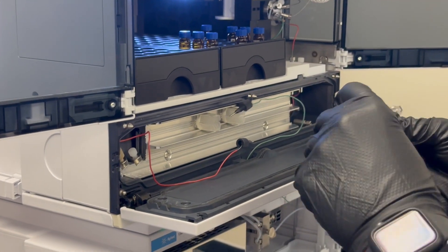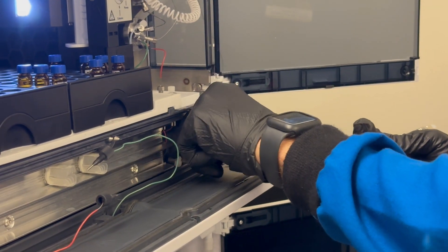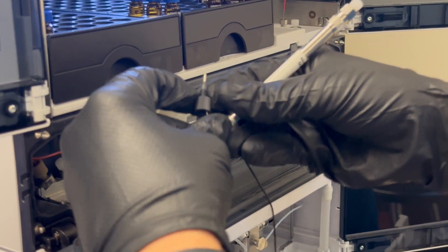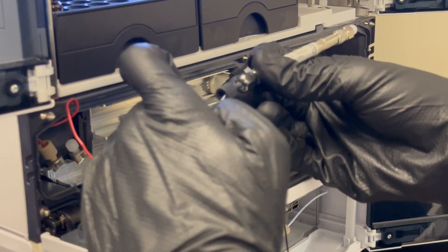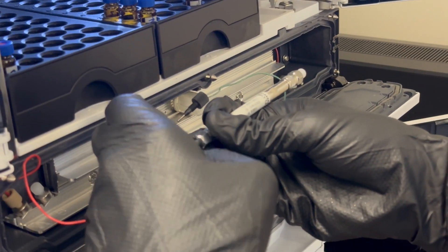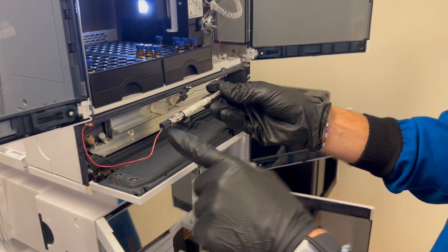So if you know where your inlet is, you can connect your inlet first. Set your PEEK caps inside of the column oven, and then what you want to do is press this line and seat it into the column. Then, while continually applying pressure, tie in and screw that PEEK fitting — just finger tight. That's it. Now our inlet is connected.